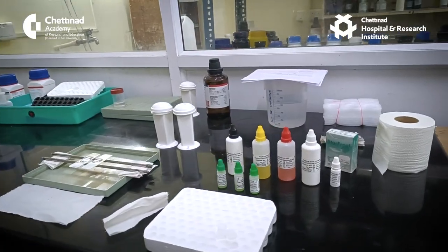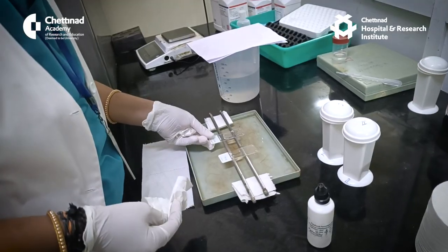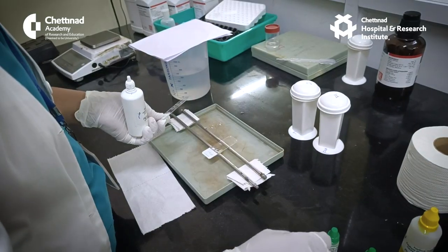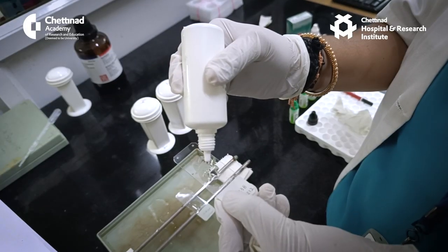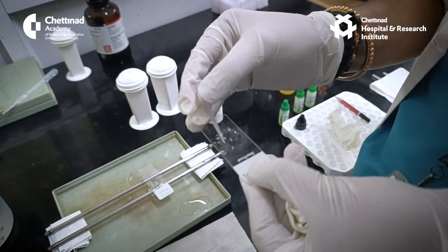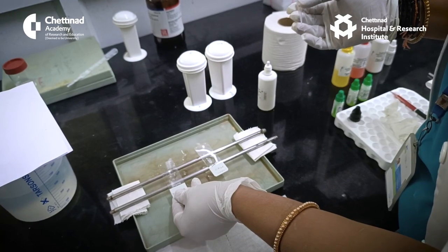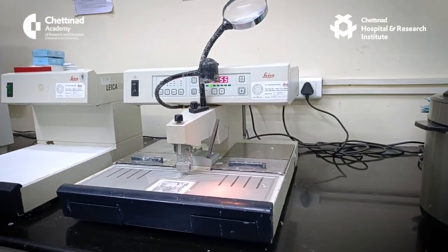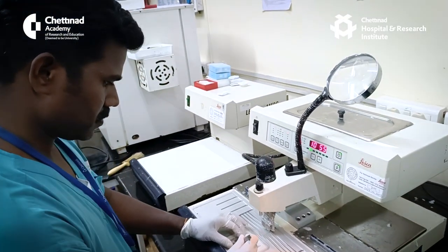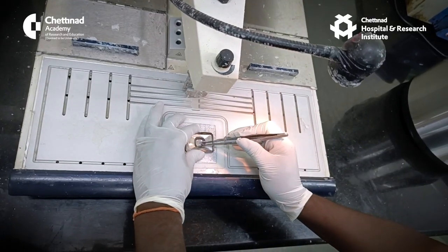The field of surgical pathology evaluates tissues removed from living patients during surgery or other invasive procedures in order to diagnose disease and aid in the development of a treatment plan. It also provides information regarding prognosis, such as status of surgical margins, complete or incomplete removal of disease, size and extent of disease including tumor invasion into adjacent structures, tumor grade — well, moderately, or poorly differentiated — and presence of metastasis to regional lymph nodes or distant organs.